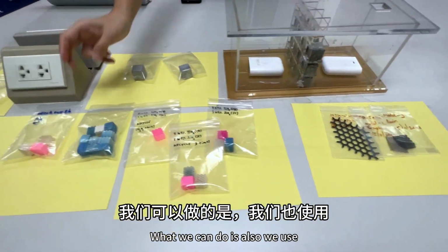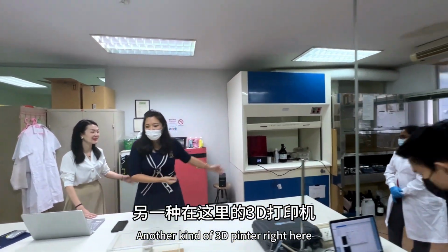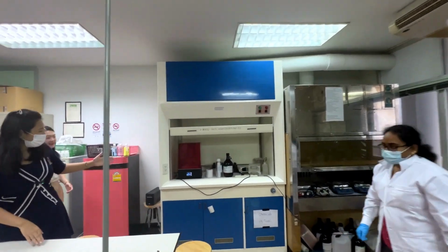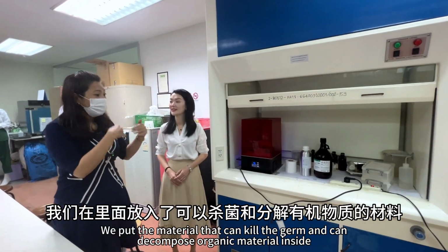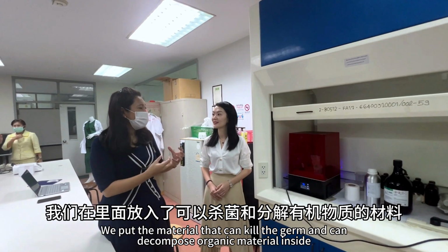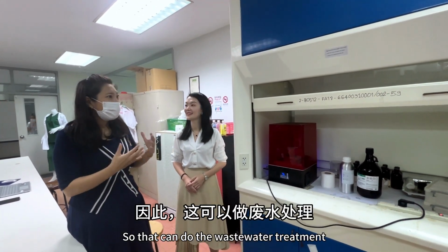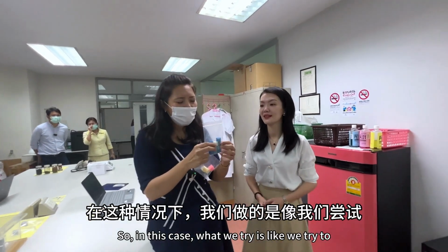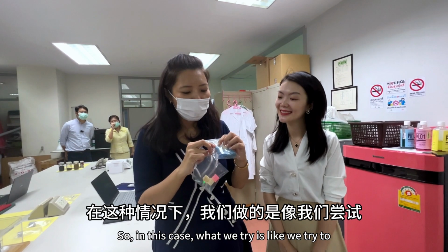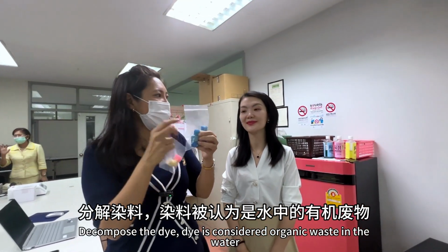We also use another kind of 3D printer right here, called stereolithography. We put in material that can kill germs and decompose organic material, so that it can do wastewater treatment. In this case, we try to decompose dye, which is considered organic waste in the water.